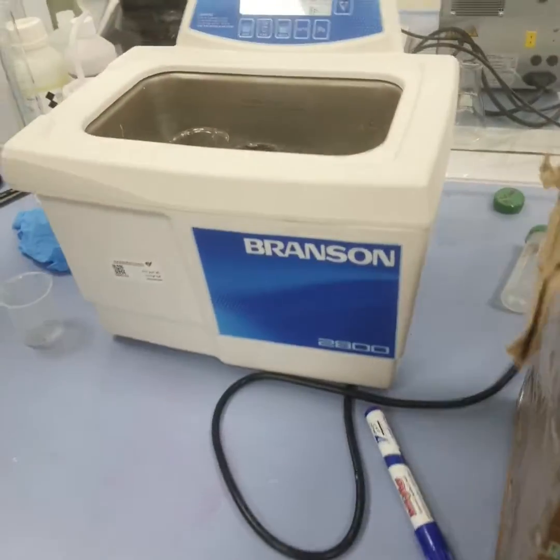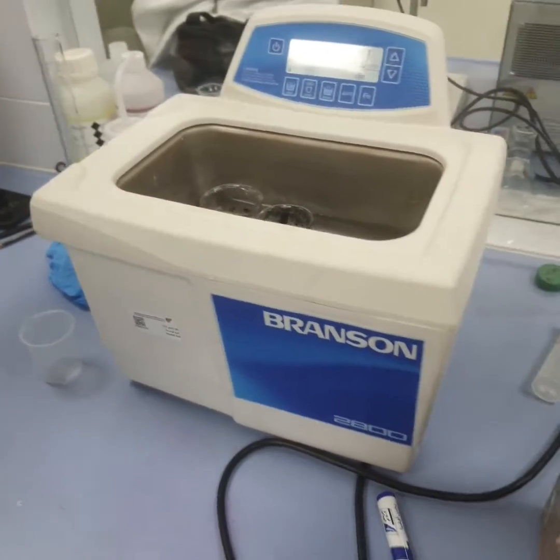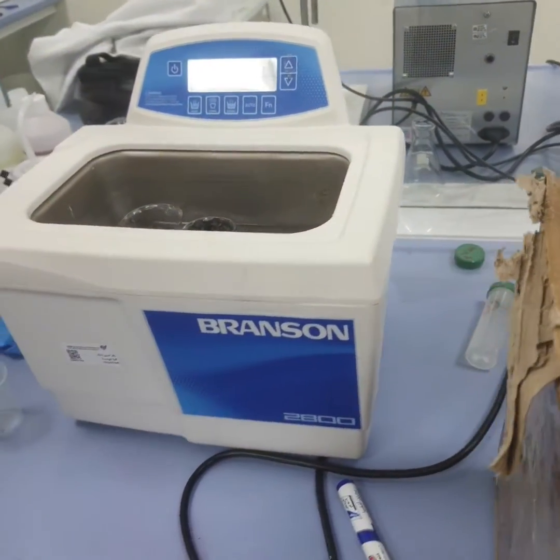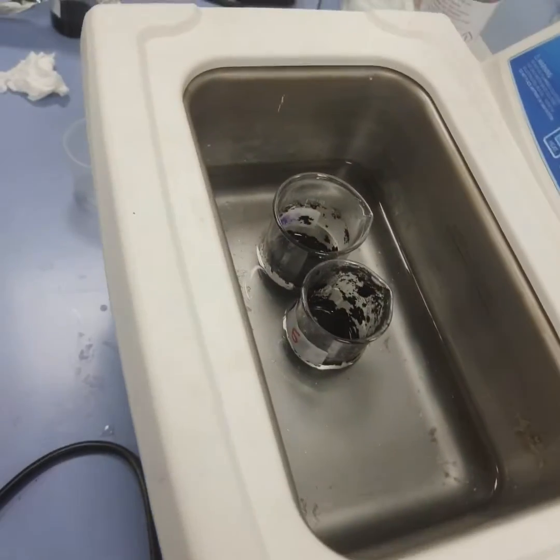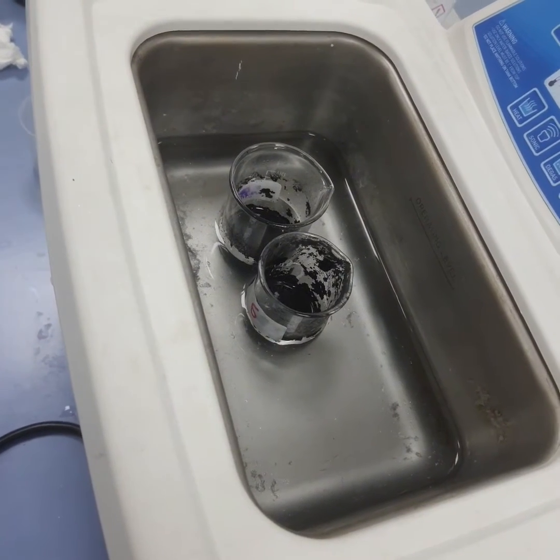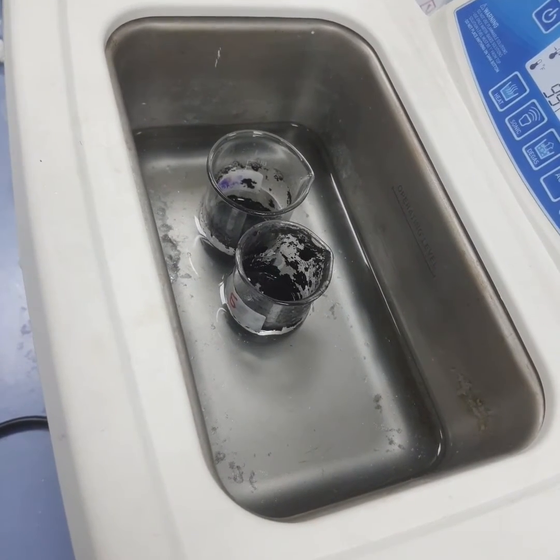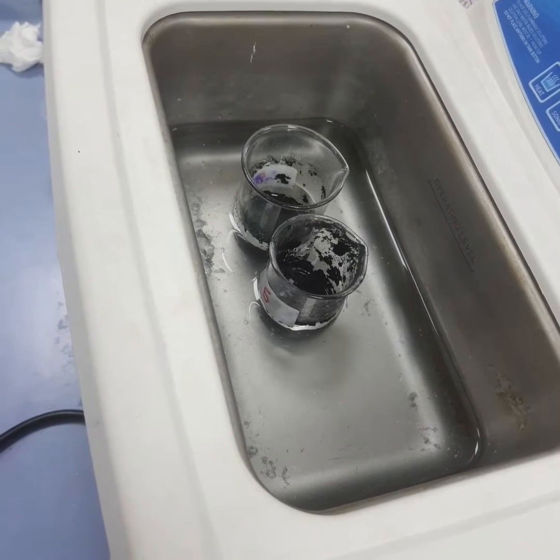Hello, we are students from Imam Abdul Rahman bin Faisal University. We are today here in the environmental engineering lab. We prepared those two beakers yesterday. We used activated carbon, CNF, DMF and PCL in order to create our membrane that we will use to test water quality and the percentage of different kinds of compounds in water.